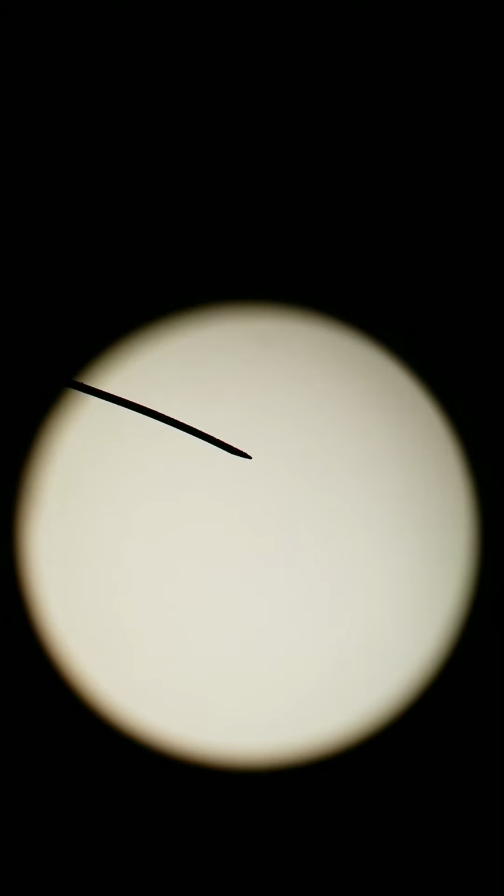So first we're going to take a look at squamous epithelium. If you're familiar, the word squamous refers to flat cells. Think of it like a pancake. If you look at a pancake top down, it looks like a nice round circle. But if you look at a pancake from the side, that would be longitudinal, it would look like a really flat line. The same is true for a squamous cheek cell. So we're going to look at a group of cheek cells first and take a look at what section they're in. So this is a cheek cell smear, squamous epithelium.